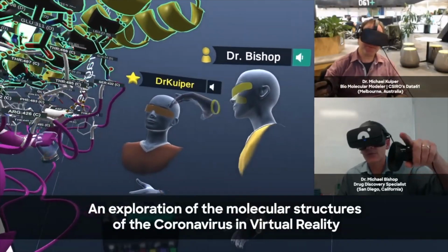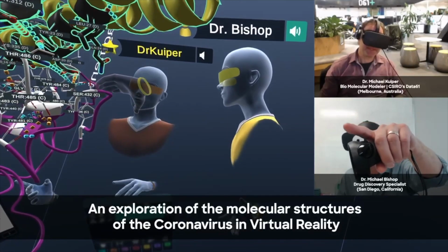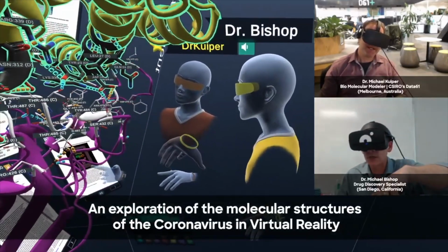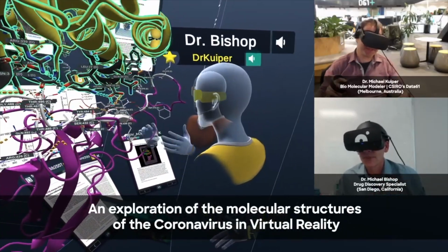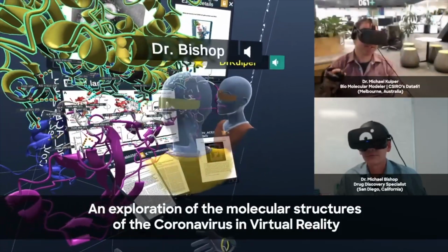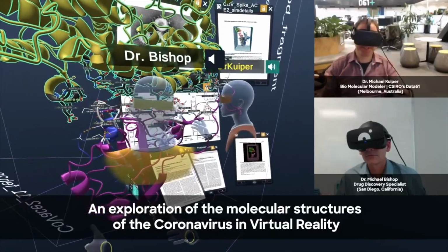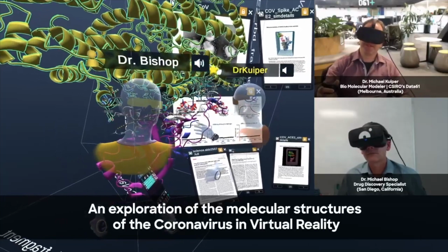And Dr. Kuiper, do you usually like to look at it in stick mode or ball and stick or van der Waals envelope type of look? What do you like to do? I like sticks. I have a personal preference for sticks because I think there's a bit more clarity there. Yeah. Sometimes if you try, say, a van der Waals, a lot is occluded, but yeah, this is beautiful. It really depends on what you're trying to look at.